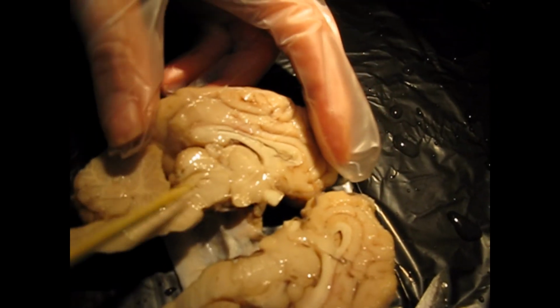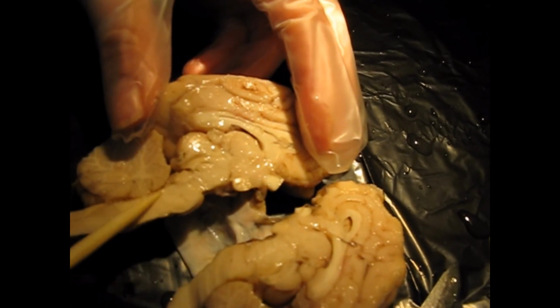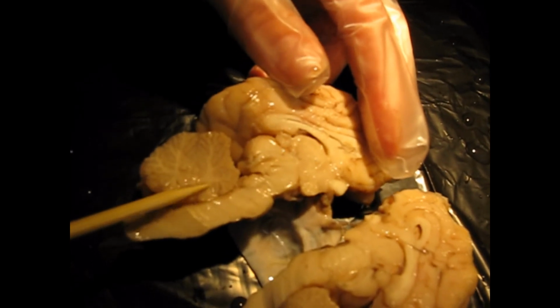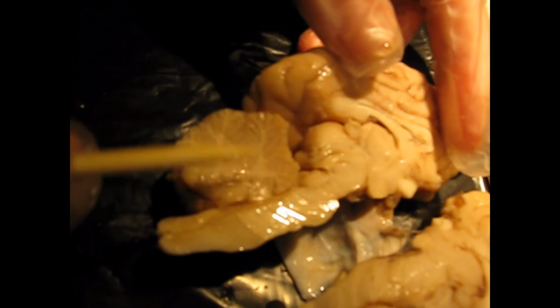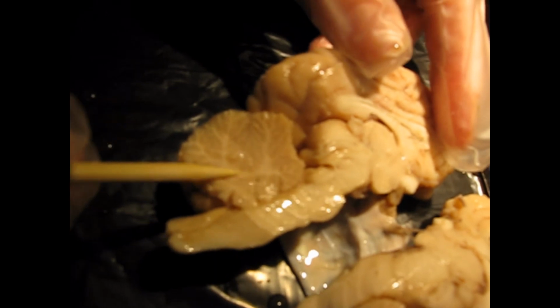Okay, remember the mesencephalon is that midbrain. That's this structure right here. Okay, mesencephalon, metencephalon, also known as the pons, and then myelencephalon, also known as the medulla oblongata. Okay, then we're going to visit a little bit about the cerebellum, which is this structure right here, and then there's these little white fiber tracts, and they're called arbor vitae, or the translation is the tree of life. Okay, so they're really beautiful, actually.